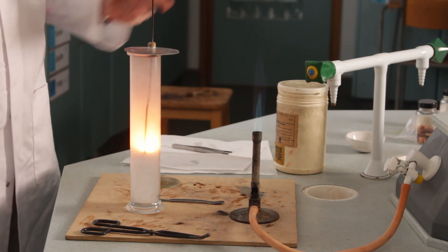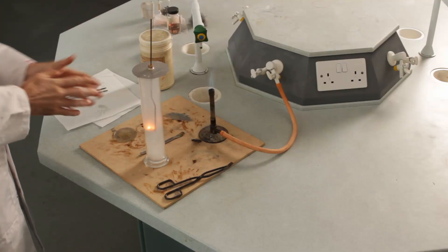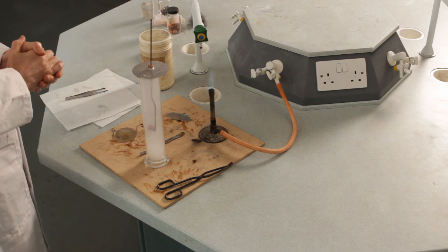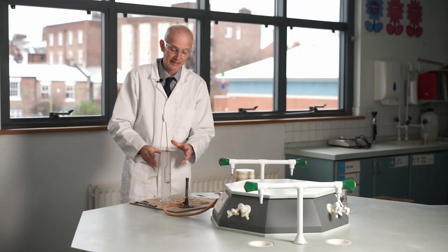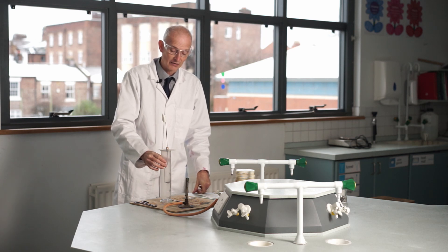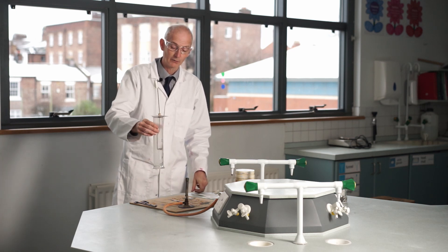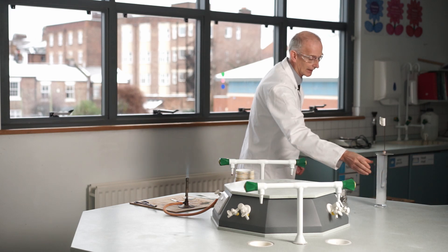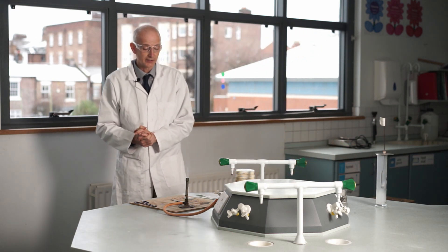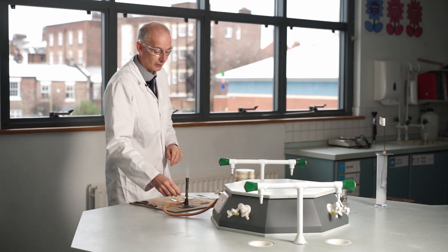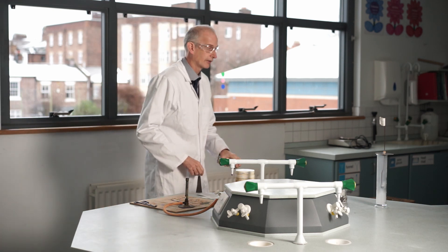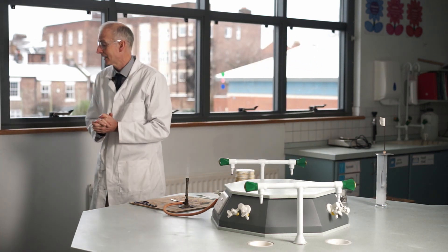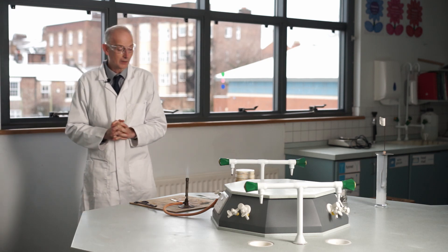If you think about what the composition of air is and you think about what the composition of the gas in that jar, i.e., oxygen is, you might be able to think about why it's a much more vigorous reaction in oxygen than it was in just the air. That was a bit of fun. If you look at the experiment sheet that you've got, we've got various other things that we would like to heat up in air. We've done zinc, we've done sodium, we're going to do copper next.